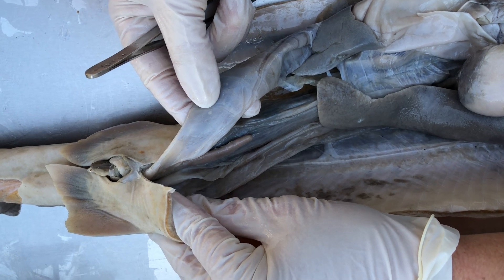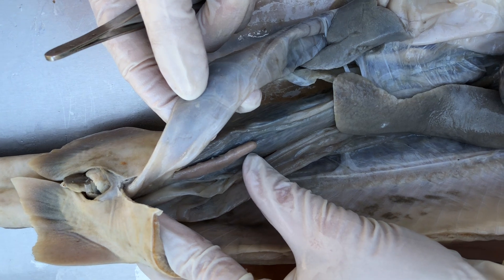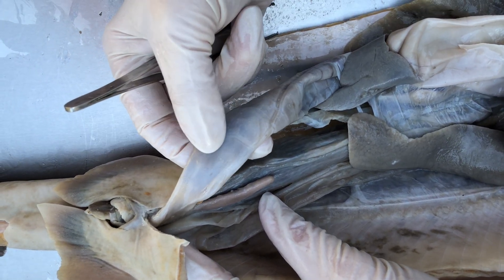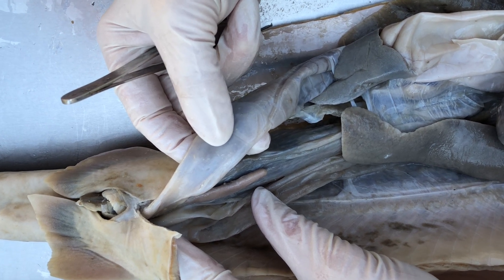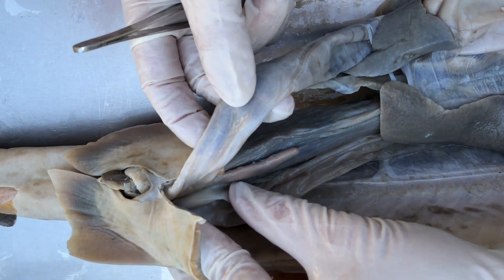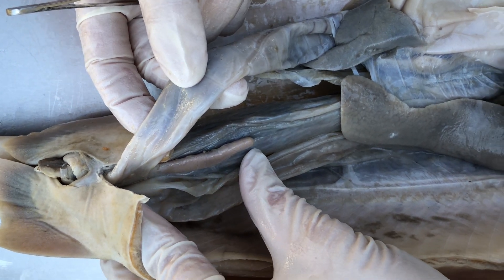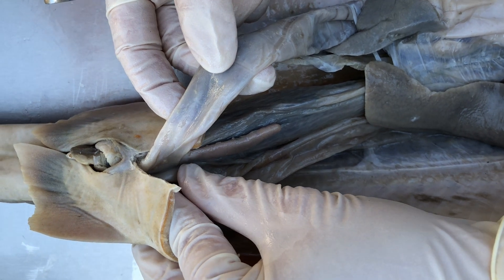This is just a quick little add-on to the digestive system — we could have done it just as well with the excretory system too. I'm holding and rotating my thumb around the spiral intestine, my fingers on the colon, and you can see there's this finger-like organ sticking up anteriorly to the colon, and then it's going to drain into the colon.